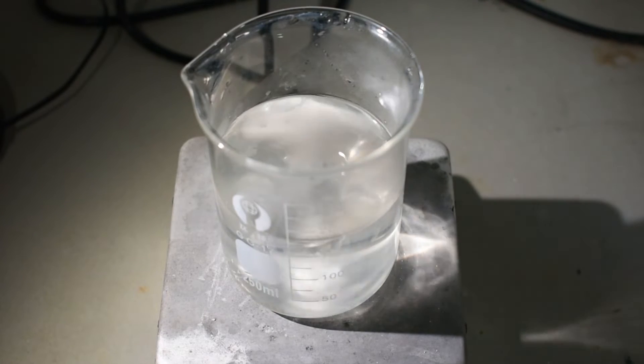Okay, all the peroxide has been added. Now all I have to do is let this stir and react for a few minutes, and then I'm going to cool it down in the refrigerator.